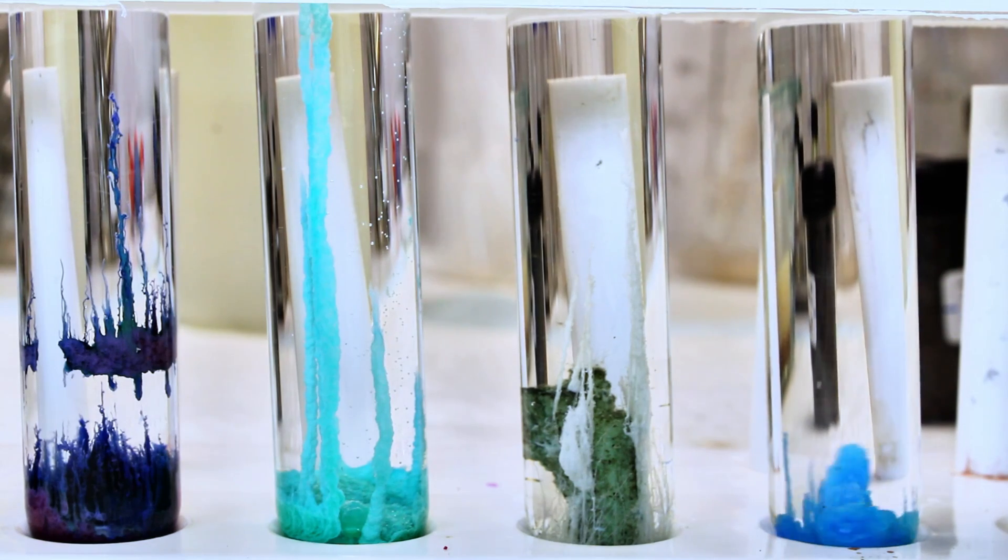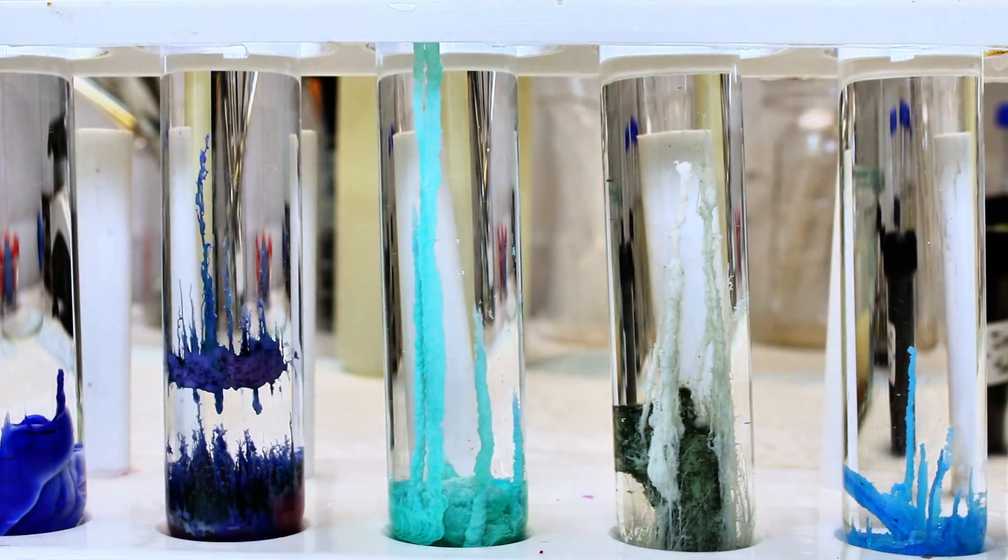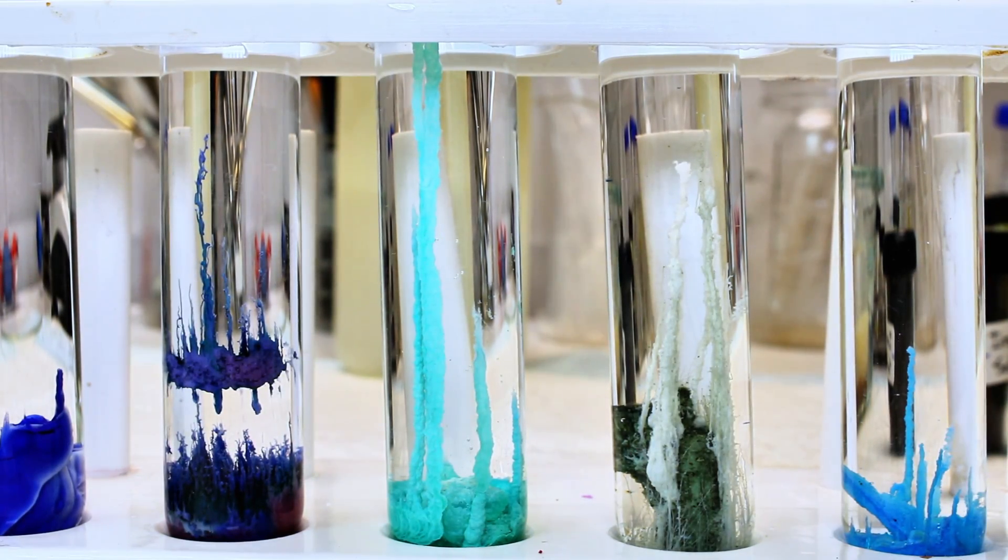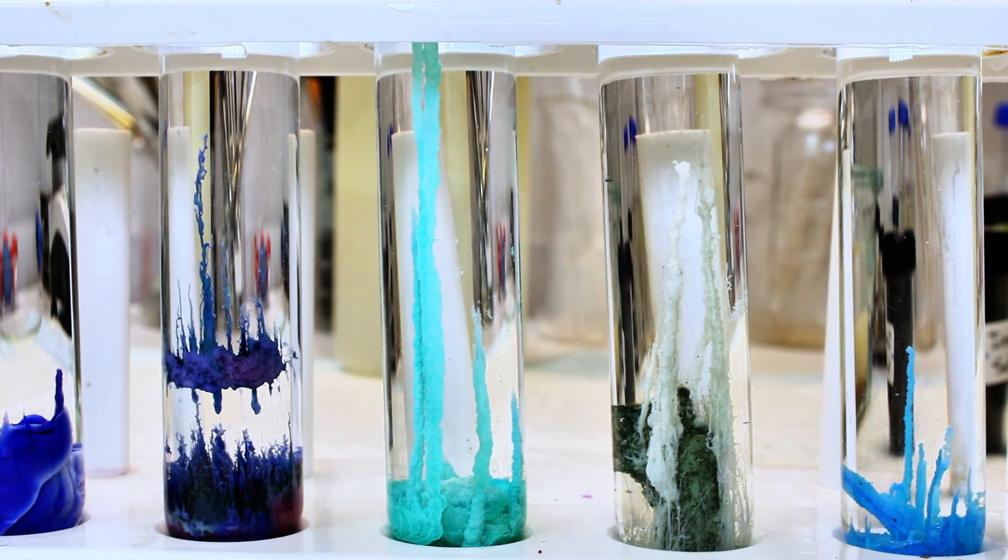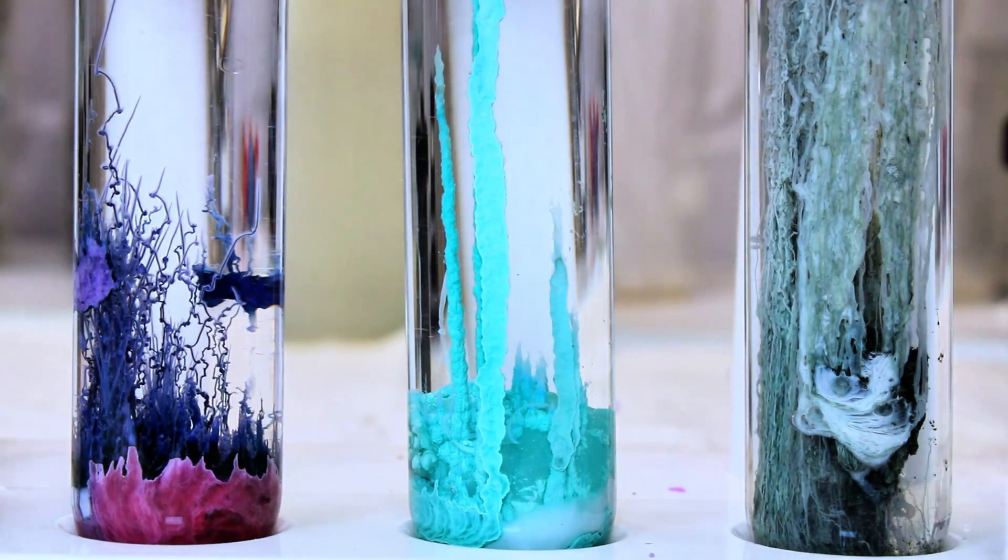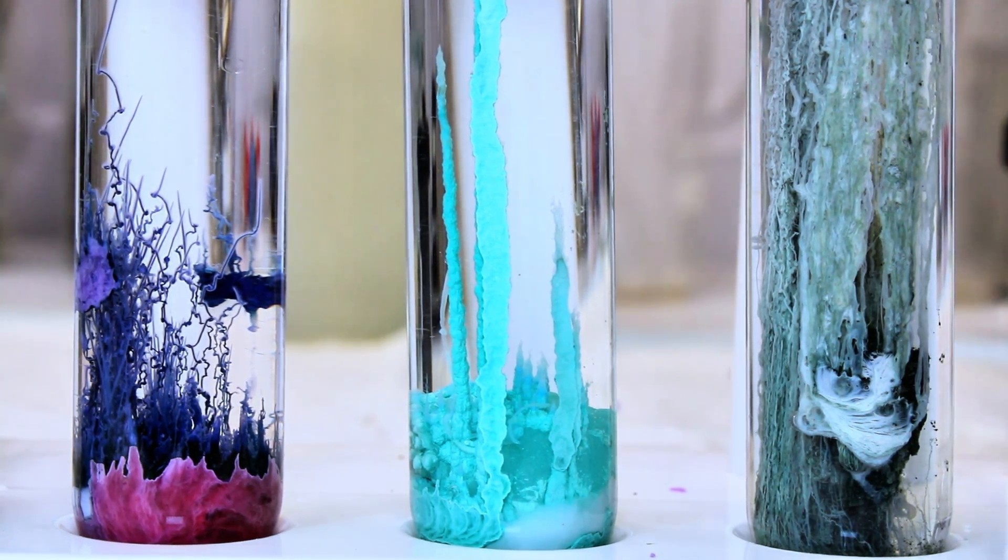I haven't done this enough times to say for certain, but it seems as though the structure of the growths is related to the solubility of the salt used, and possibly related to whether the specific salt is capable of forming hydrates.